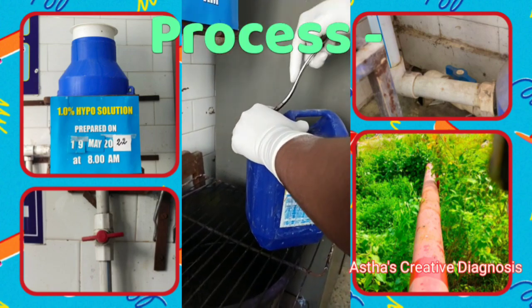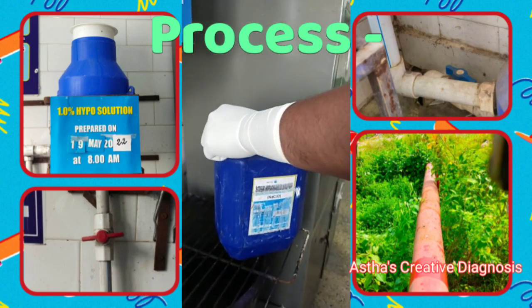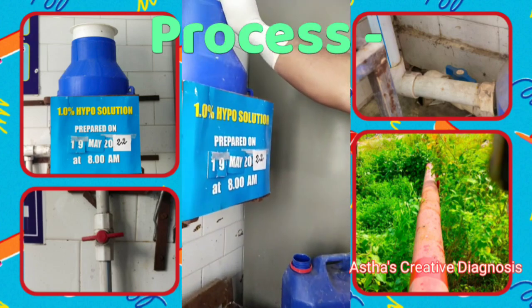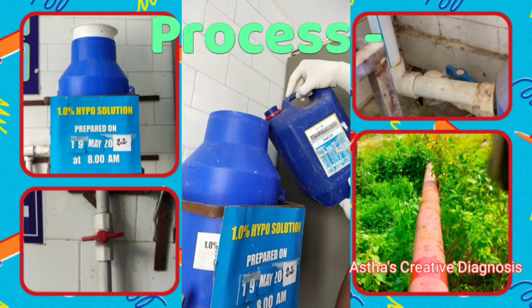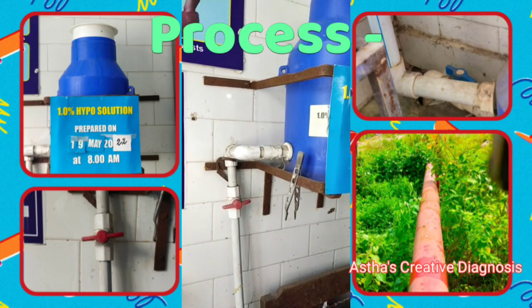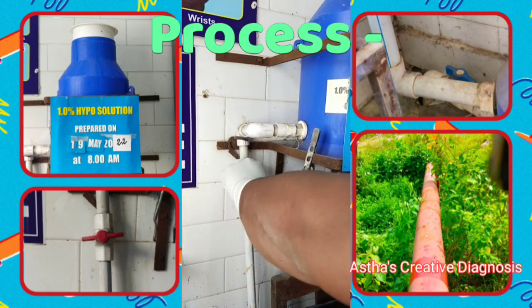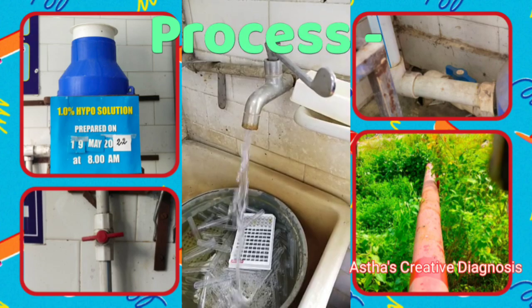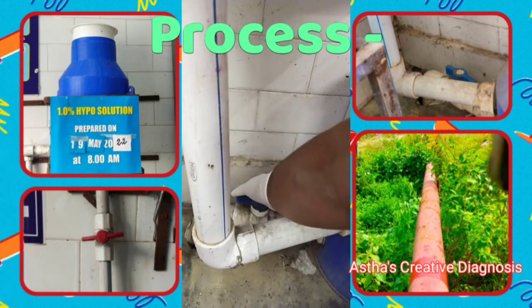The process of liquid waste management: first of all, fill the chlorine solution container with 1% chlorine solution. Then open the inlet pipe knob and fill the waste container with 1% chlorine solution. After ending all the work, open the outlet pipe knob.